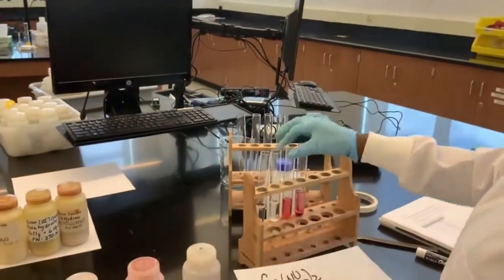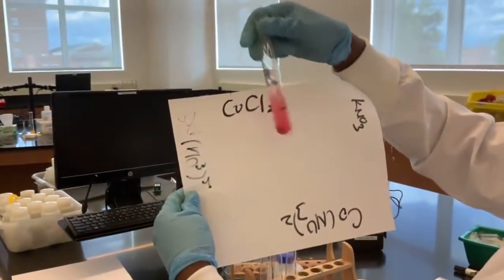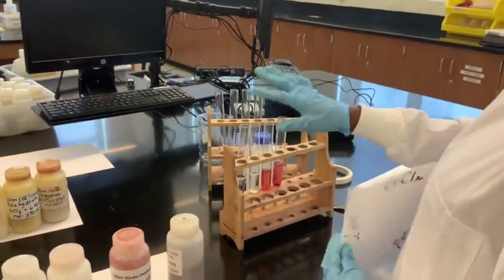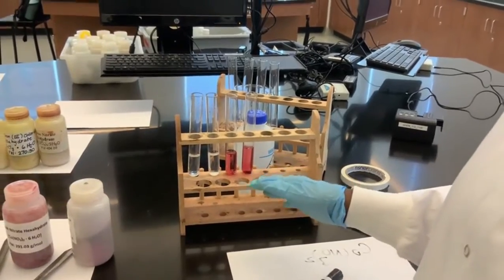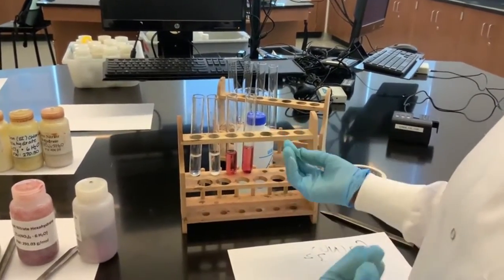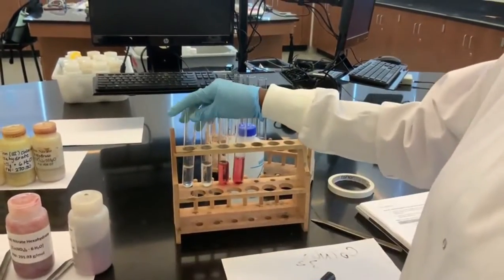Let's look at cobalt chloride. It's also a nice red color, as you can see from here, as it dissolves. Among all these 4 salts, just looking at the colors they give in solution, you should be able to determine whether it's the anion in the compound that is giving the color or the cation that's giving the color by just comparing the 4 results we will see.